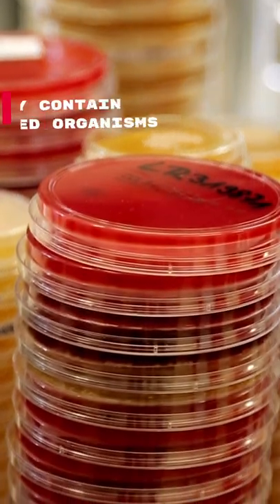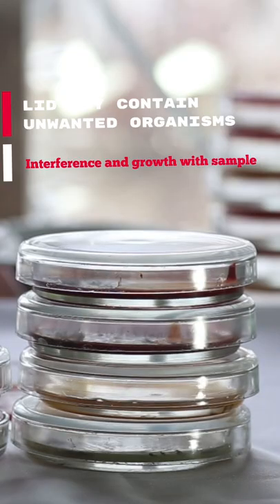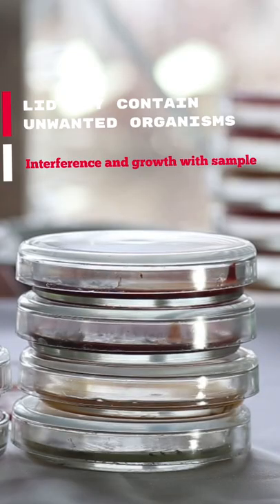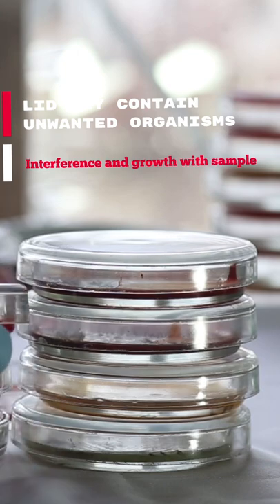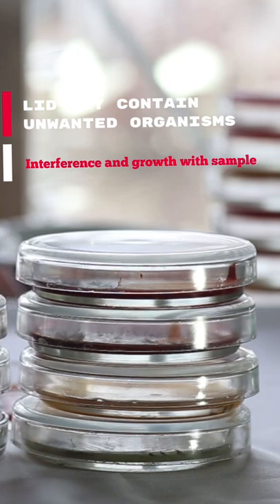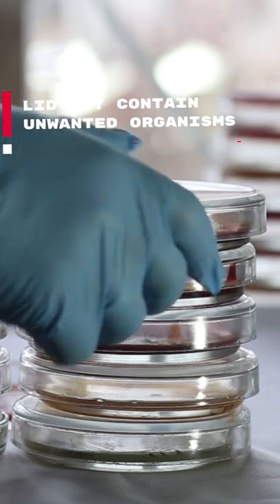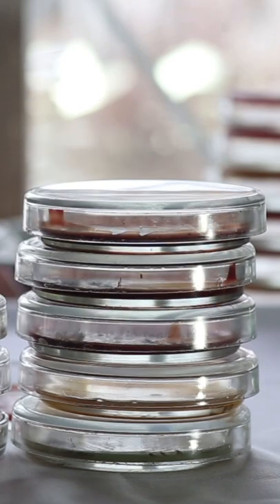The lid of petri dishes may contain contamination that spreads onto the media and grows with the sample microbes, which may create an error in microbial count determination.